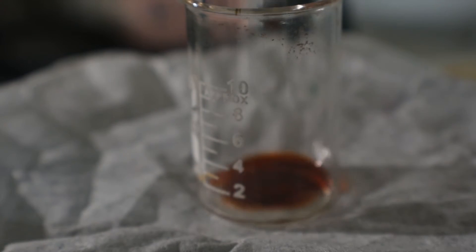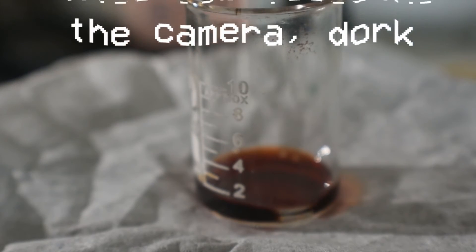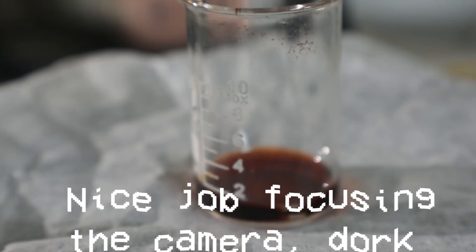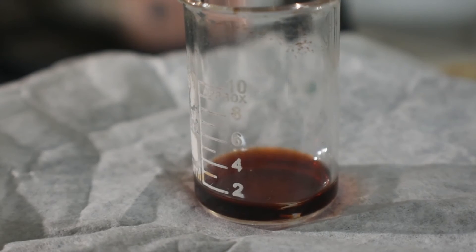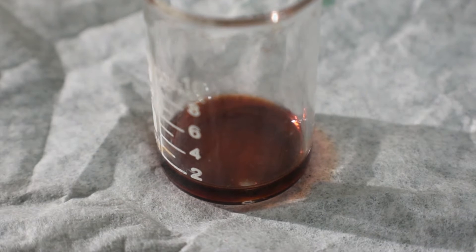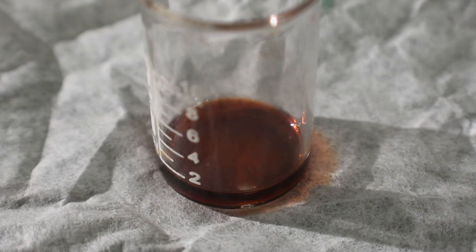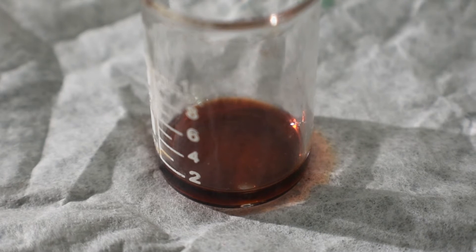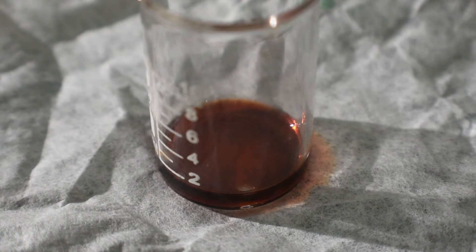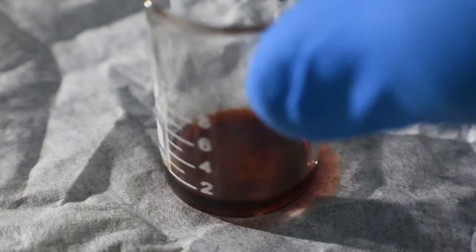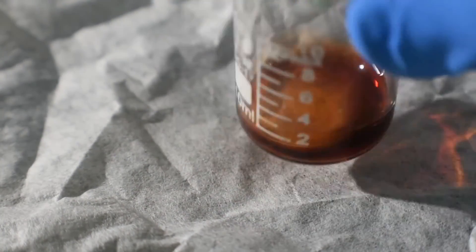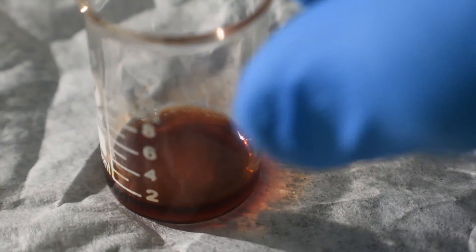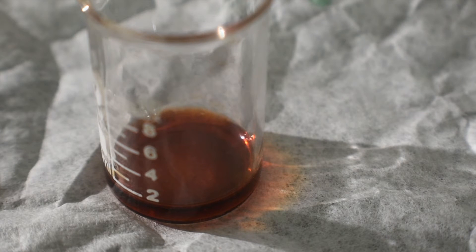As we can see, it's fairly stable in air, at least for the moment. It's been out from under the toluene for about 1 minute 30 seconds now, and it still hasn't shown any signs of rapid oxidation. Let me give it a little swirl here. And it's still pretty much that same color.